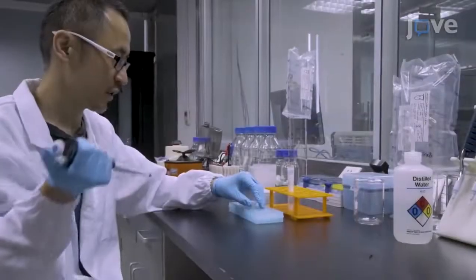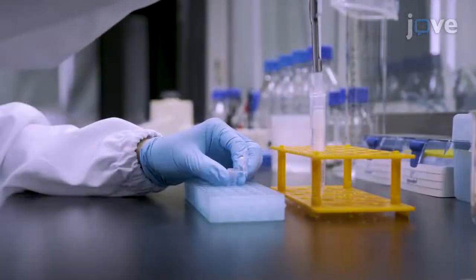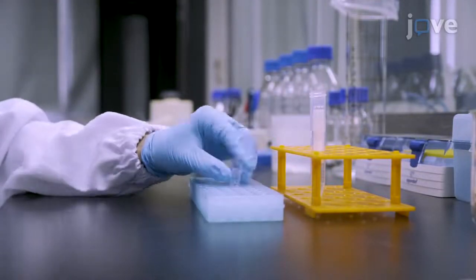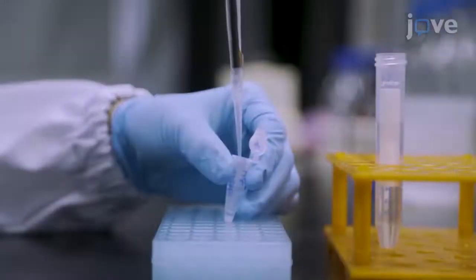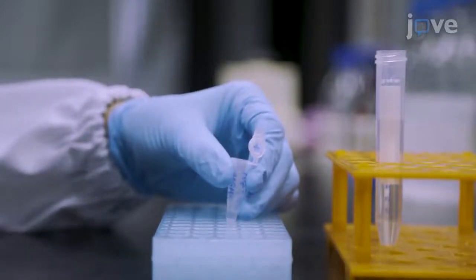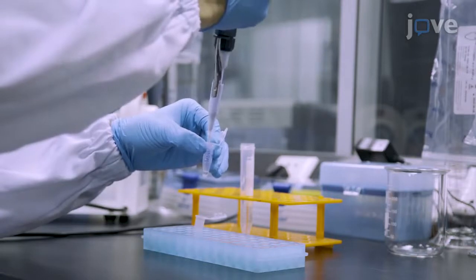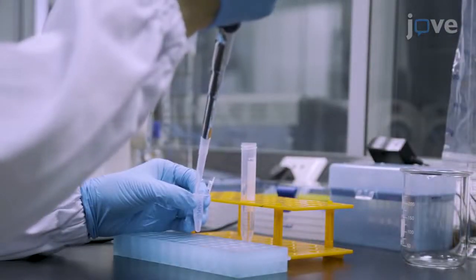Begin by preparing protein A beads bound with anti-GFP antibody. Wash 25 microliters of protein A beads per immunoprecipitation reaction with buffer A1 at least 3 times to remove the ethanol. Then make a 50% bead solution with buffer A1. Add 2 microliters of anti-GFP antibody to the beads. Then add buffer A1 to 20 times the net bead volume.